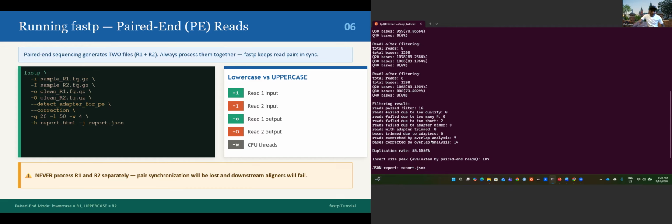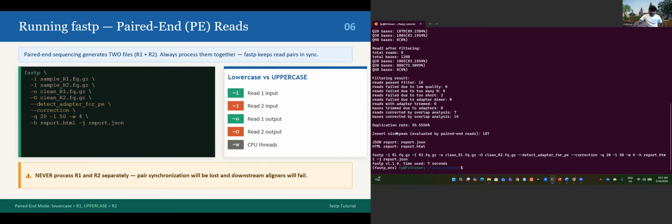Reads corrected by overlap analysis: 7 reads corrected. This is because I put the correction, you see the dash dash correction. This is for the overlap analysis. Bases corrected by overlap analysis: 14 bases corrected, and 7 reads corrected by overlap analysis. You see the duplication rate is 55%, and the insert size peak is about 187.